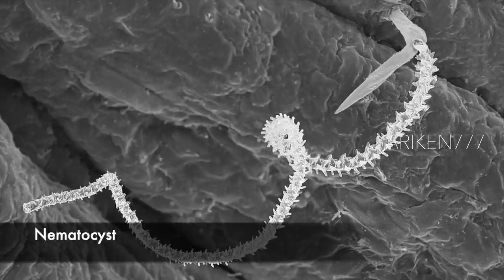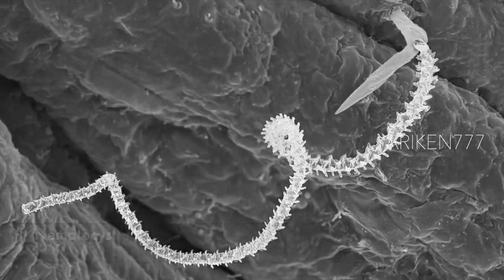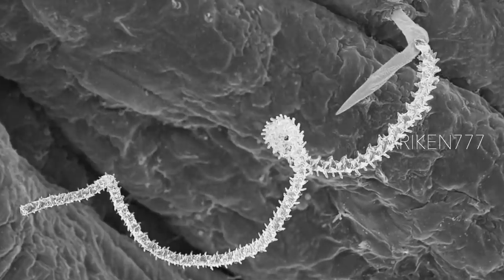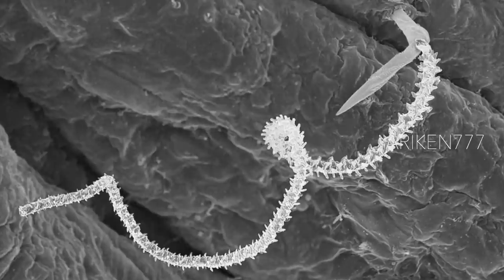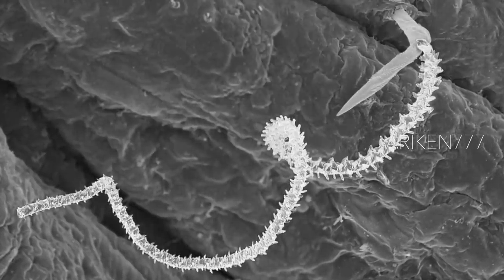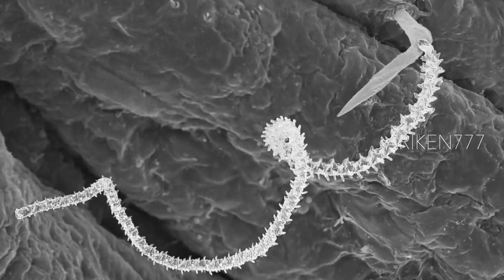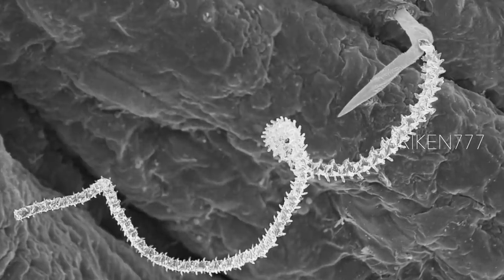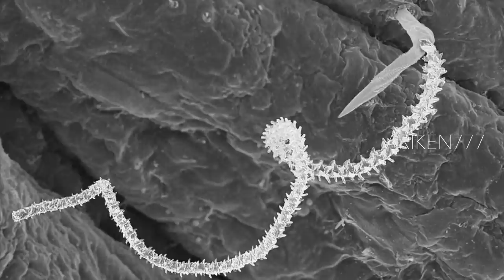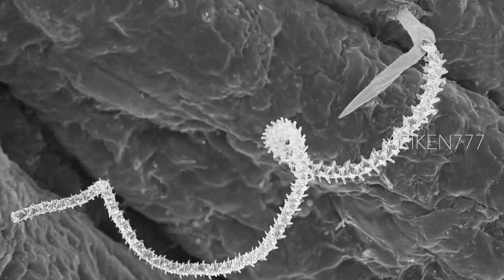A nematocyst from the tentacle of the box jellyfish. This box jellyfish belongs to the cubozoa group of cnidarians. Like all cnidarians, cubozoans possess nematocysts — cells that fire a barb and transfer venom. When a nematocyst contacts something that might be prey or predator, the barb uncoils and fires from the capsule along with toxic venom.